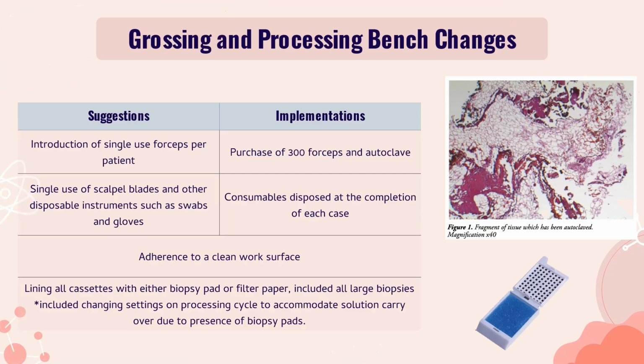Here are the implemented changes at the grossing and processing station. The team purchased a large number of forceps and an autoclave machine, and the photo on the right shows an example of a tissue fragment that was autoclaved, showing no viable tissue present. They also committed to disposing consumables at the completion of each case. Additionally, they emphasized a clean work surface in the lab at all times and mandated lining of all cassettes with biopsy pads or filter papers. This also required a change in the settings on the processing cycle to accommodate solution carryover due to the increased number of biopsy pads used.